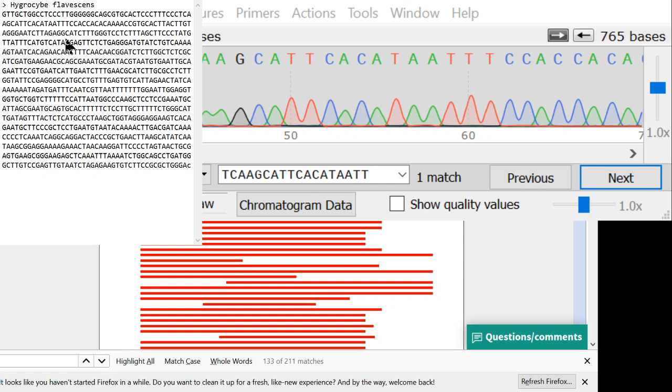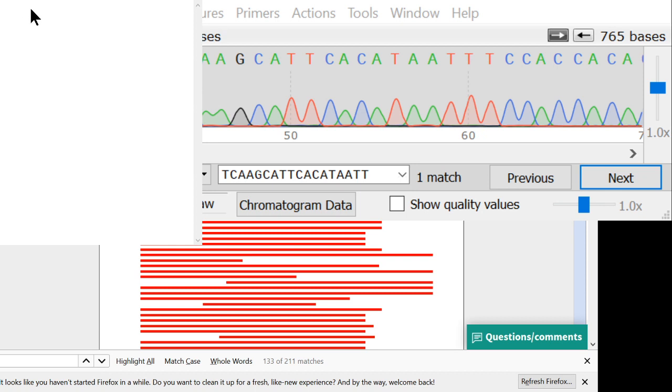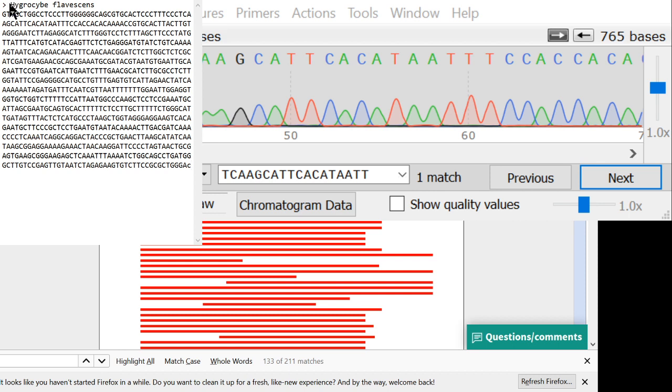And so save that. I think they're going to want us to call that a .fas. Saving it as .txt is not going to be good, because that'll confuse GenBank. So Hygrocybe flavescens, paste, and now we have to save it. We'll call it flavescens.fas. It is a FASTA, which is a text format, but they're not going to want to see the .txt on there. So now we have a file called flavescens.fas, and we have to add it to GenBank.